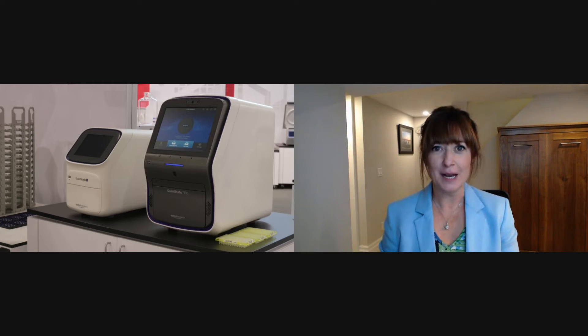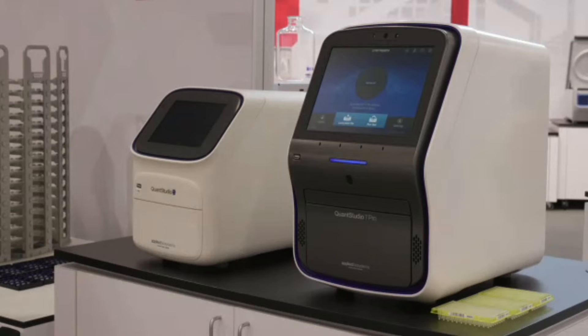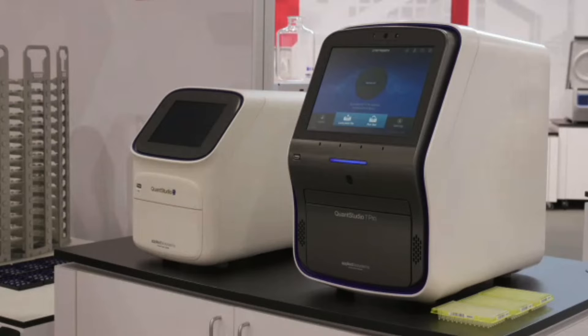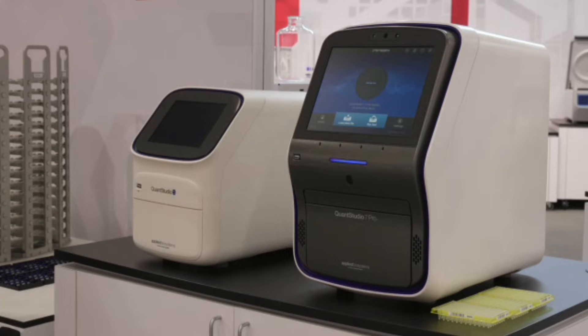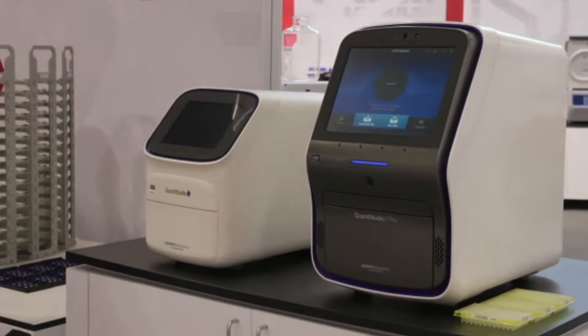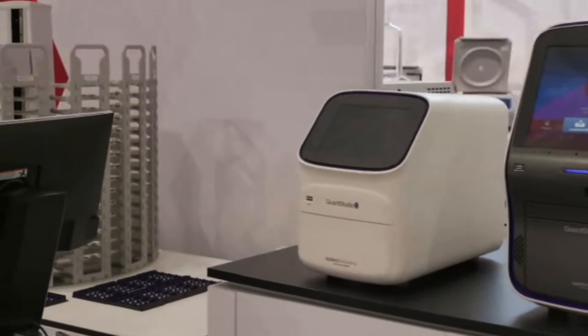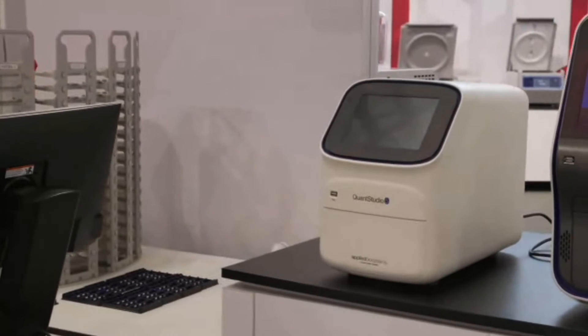Hello and welcome to Lab Talk. Today is an exciting day. As you can see here beside me in the view, we have the lab here, and we're actually talking on this Lab Talk about the qPCR systems. You can see here the Quant Studio 7 and the Quant Studio 5, both manufactured and sold by Thermo Fisher Scientific.